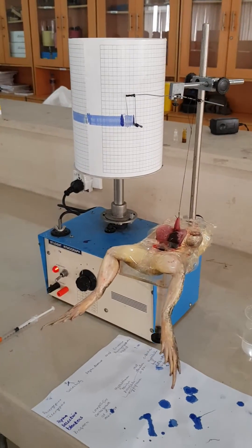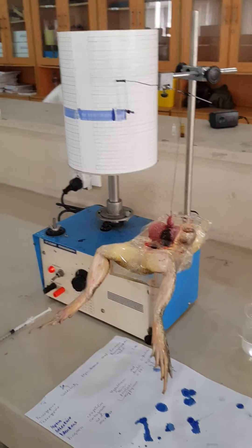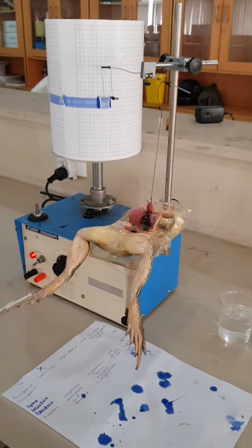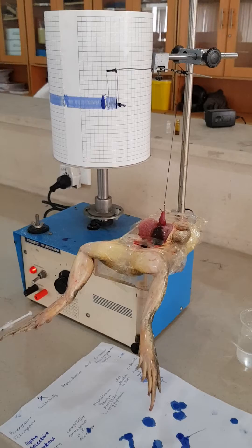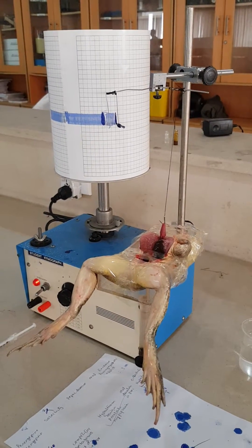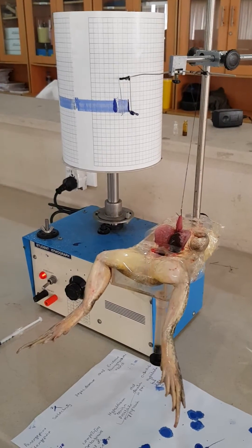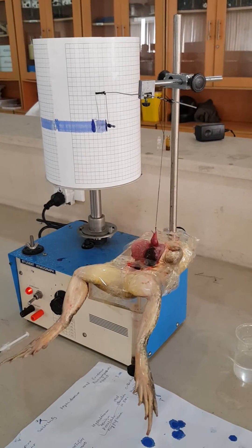This is a Frog Heart Practical on the kymograph. We will use different drugs and observe the movement of the heart, up and down. We will study the drug effects on the heart.